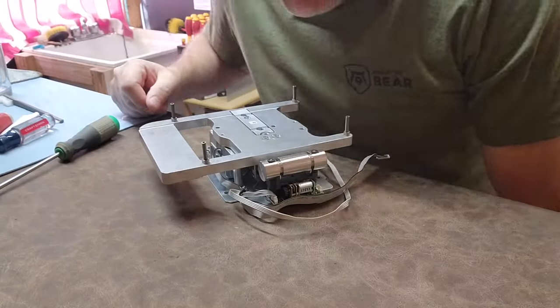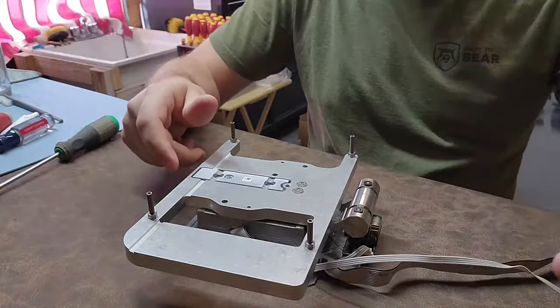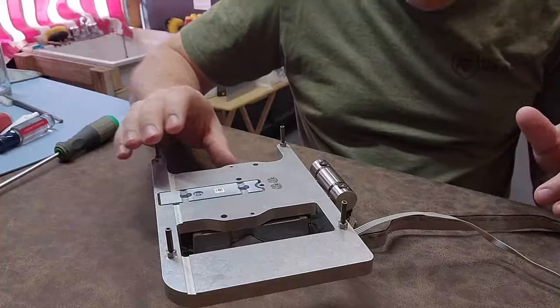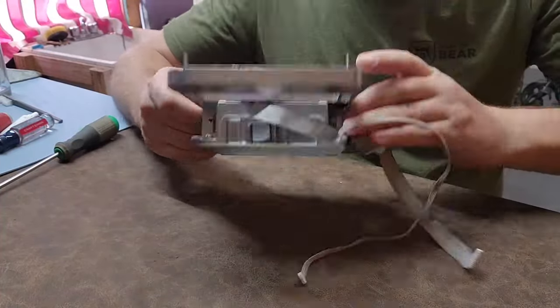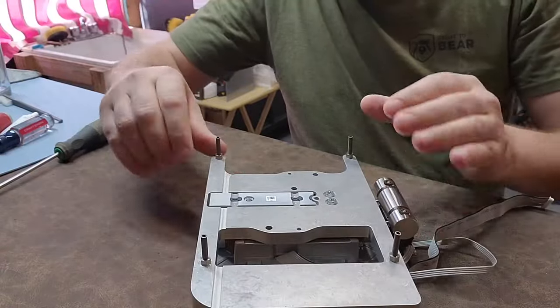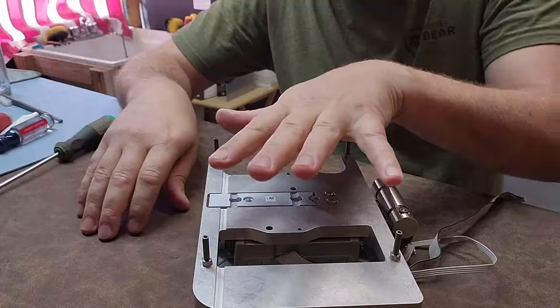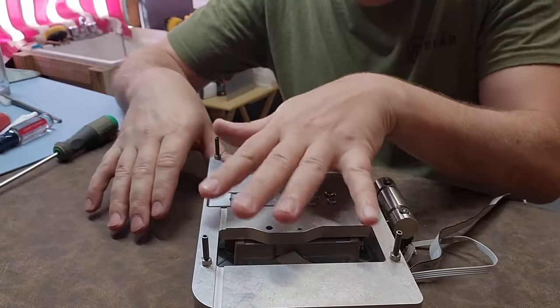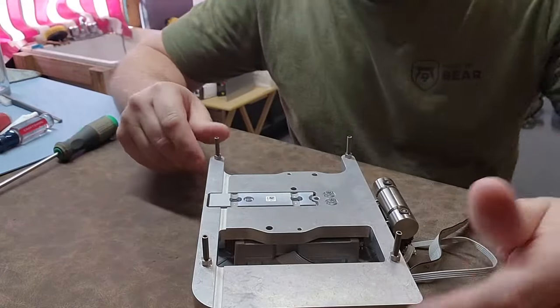This is the pharmaceutical grade scale — it's got just a couple leads coming off of it. The first thing I want to do is give you the layout of what this does. We have the mounting platter down here on the bottom, and up here is where it receives a tray. These are guide pins and the tray will come in and park right here — they center-locate it so that the load is centered on the scale.